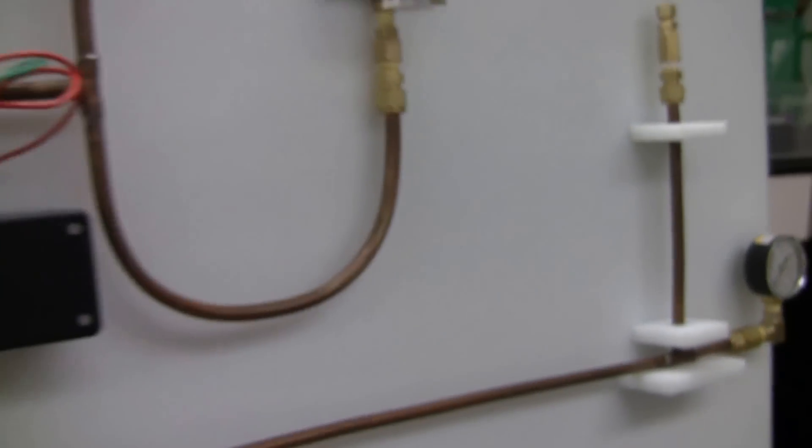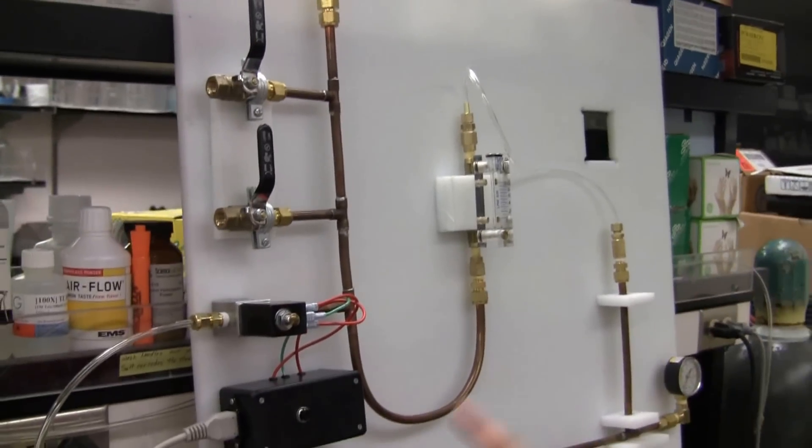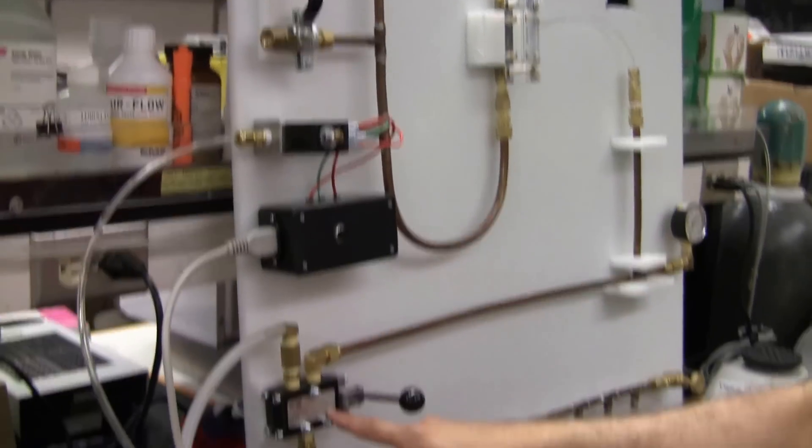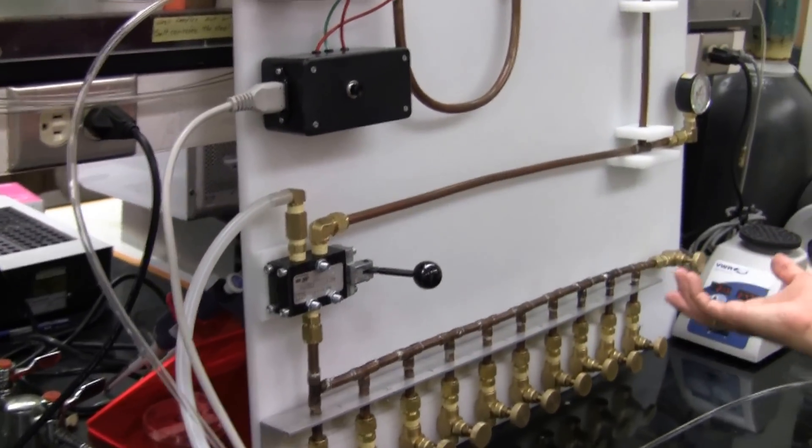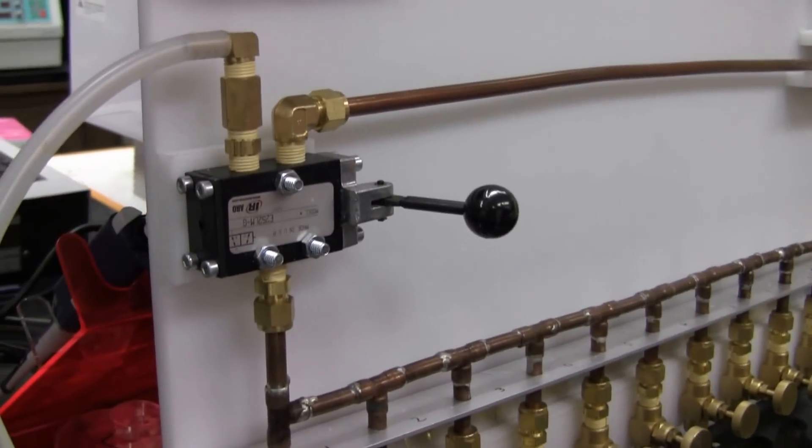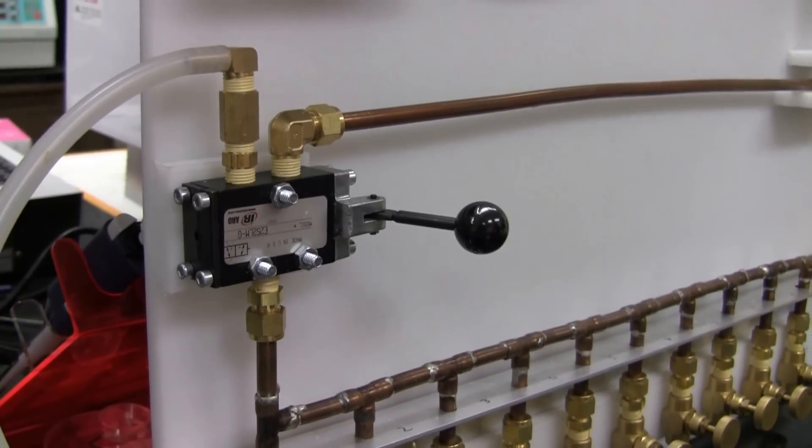A very important thing here is a three-way valve that is switching between pressurizing with your desired gas and a vacuum. It is a vacuum pump.